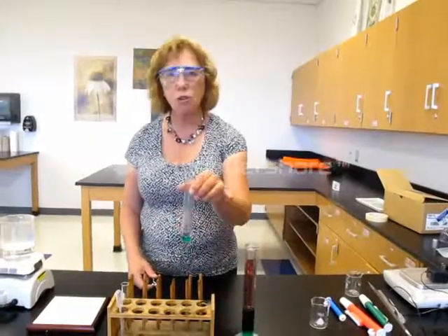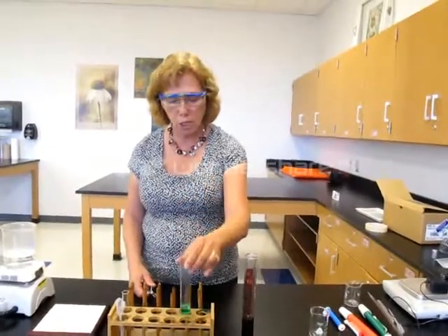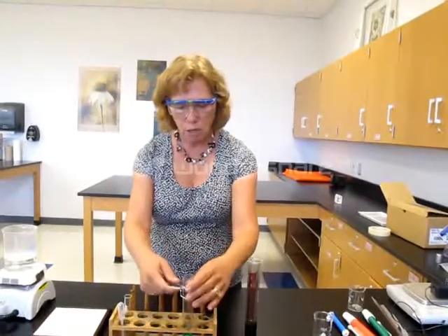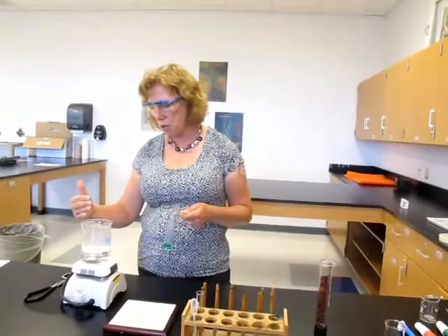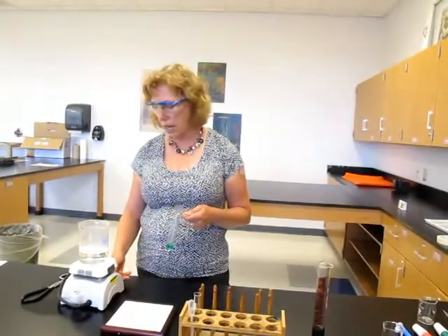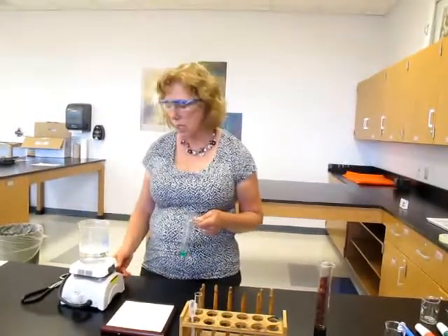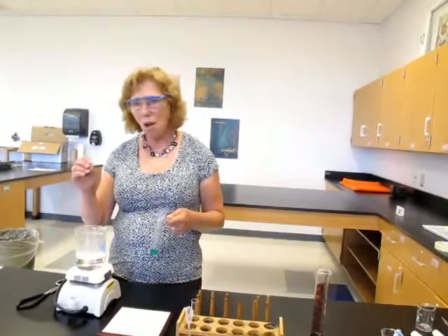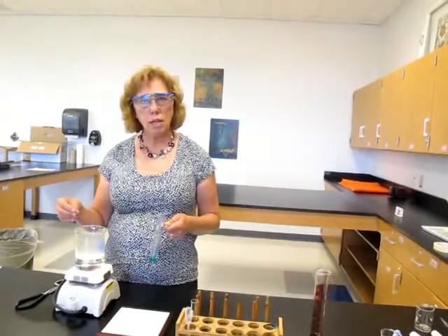We have pipetted a certain volume of solution into a test tube. Sometimes we may want to heat that test tube for a period of time. I'm going to use test tube tongs to put my test tube in a hot water bath. I set this hot water bath up a few minutes ago — I put a volume of water into a larger beaker and turned on my hot plate. One common issue is that students feel like the water bath has to be boiling really hard — it doesn't. It needs to be almost just small bubbles forming; that's usually a hot enough solution.